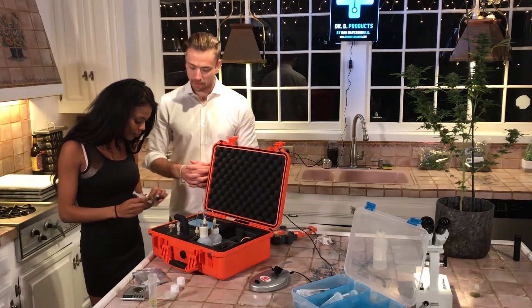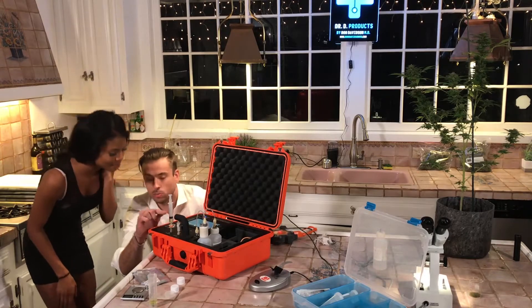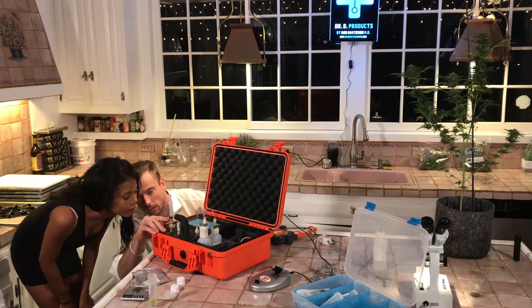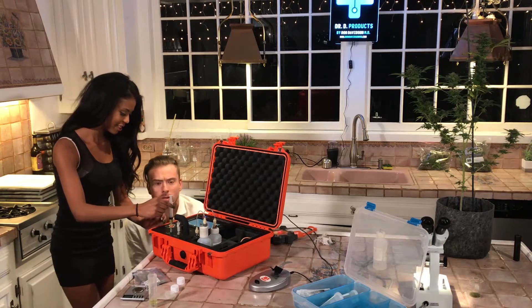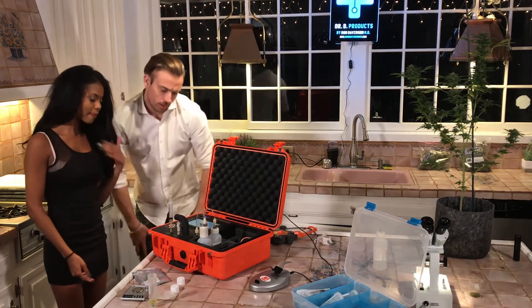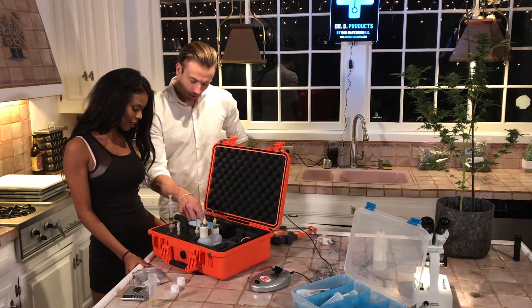Press next — it says connect the syringe to the syringe filter. Go ahead and attach that there. Press next — it says slowly inject half a milliliter of extracted sample. Take the plunger, which is now at about three milliliters, and push it down to in between two and three. That should be good enough. Press next — set valve to run. Turn this back to run and press next again. Now press start.